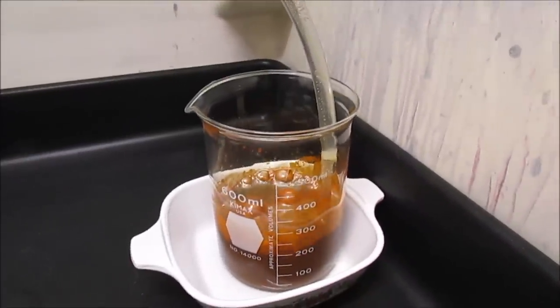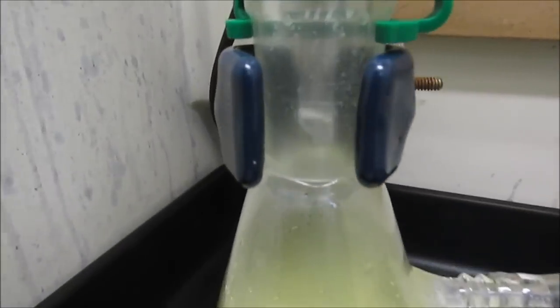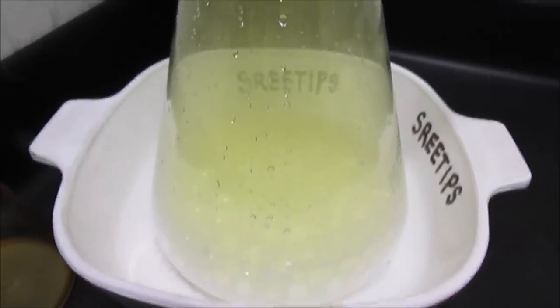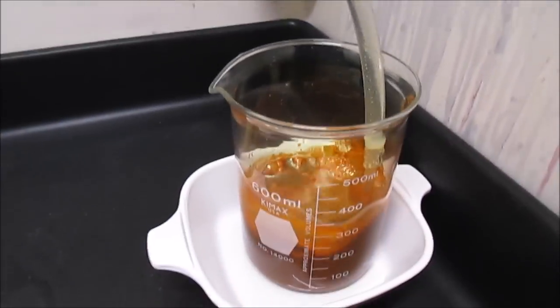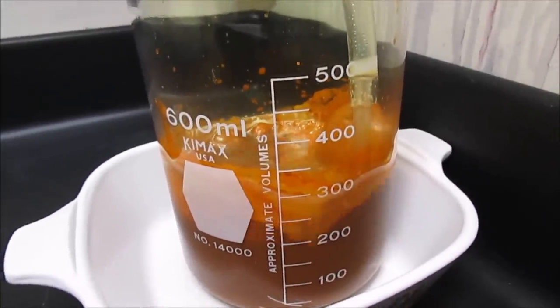I forgot to turn the camera on. What I'm doing here is I've started the chlorine gas generator, dripping hydrochloric acid from the addition funnel down into the slurry of water and chopped-up chlorine tablet. The gas goes through a tube and I can see the precipitate forming now in my palladium solution.